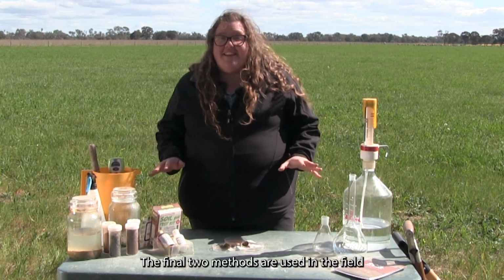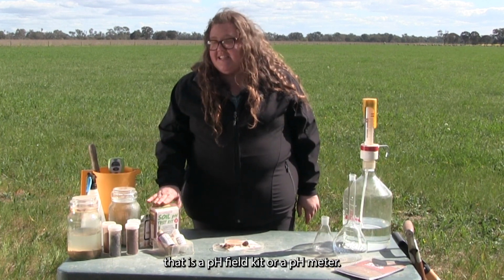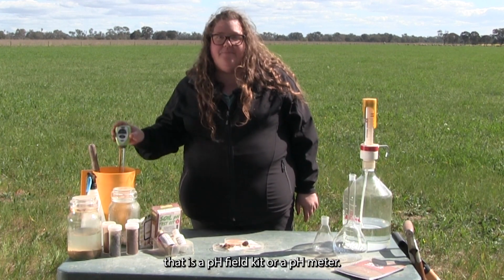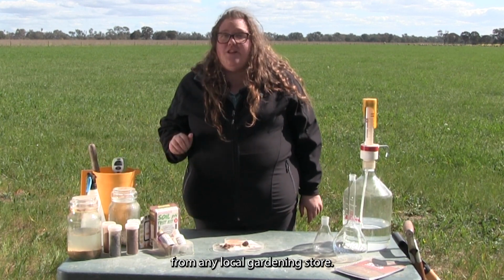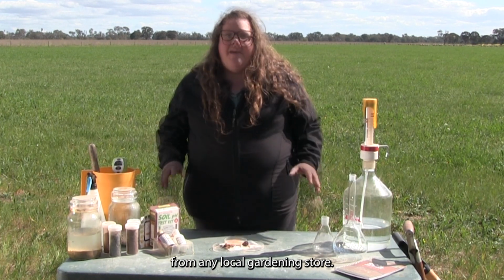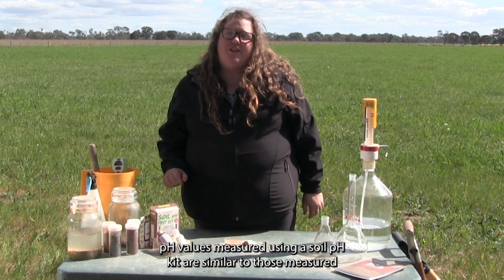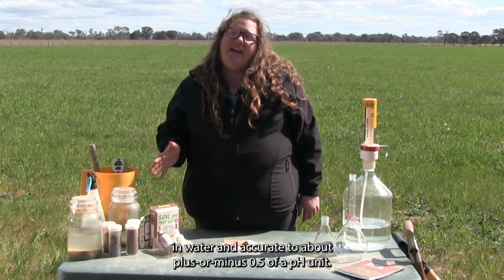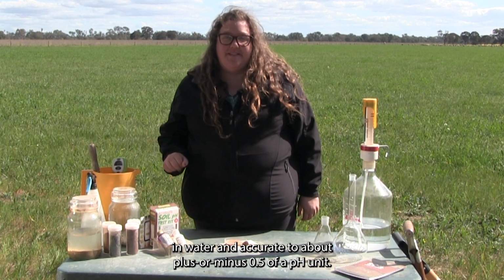The final 2 methods are used in the field. That is a pH field kit or a pH meter. We will use a kit that can easily and cheaply be purchased from any local gardening store. pH values measured using a soil pH kit are similar to those measured in water and accurate to about plus or minus 0.5 of a pH unit.